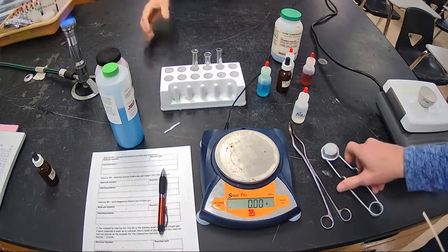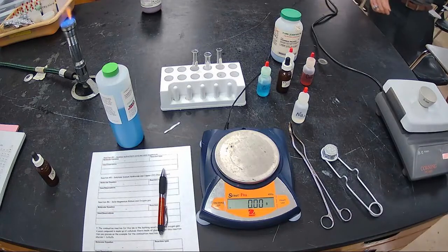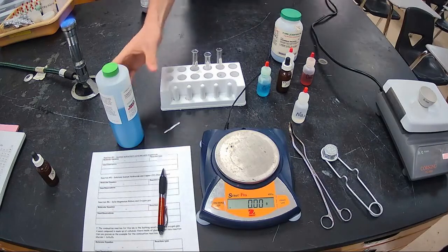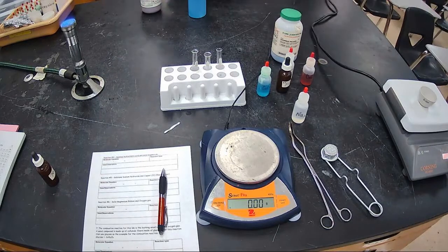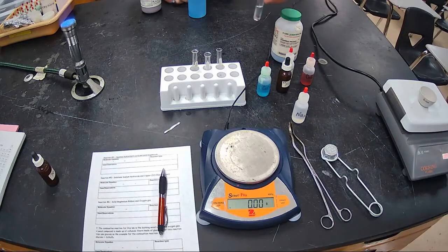So we have the flame going. The flame is just there to light the wooden splint. We're going to drop the magnesium into the hydrochloric acid, and we should see something happen almost immediately. What do you think is going to happen? Well, personally, this is my favorite reaction of the whole thing. I know that metal and acids, they don't really go well together. So let's see how that works.